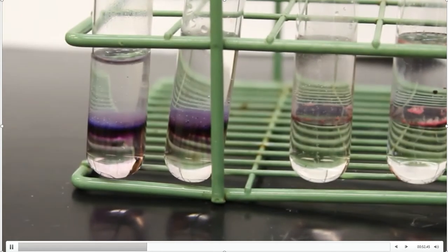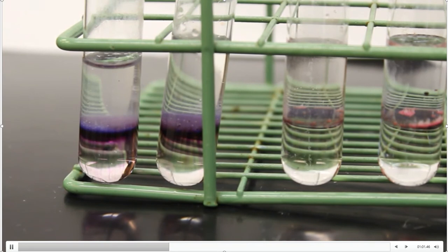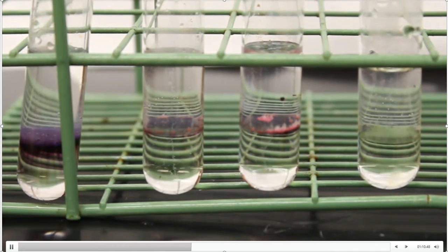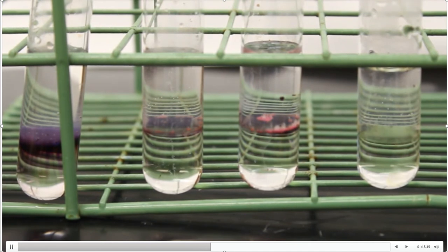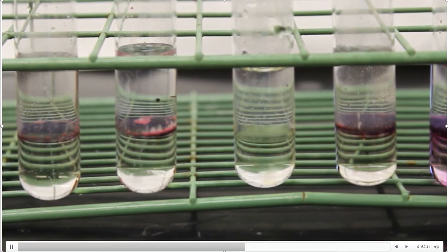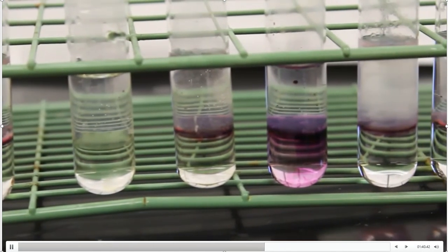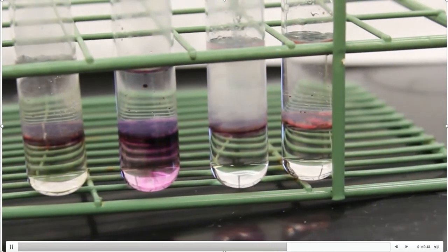I'm going to bring this forward and zoom in a little bit. The first test tube is sucrose. The second test tube is fructose. The third test tube — do you see that interface ring? Is that purpley to you? That's going to be the question you'll have to answer for yourself — that is maltose. The next one is an unknown, and beside of it is another unknown. Then we have lactose, then xylose, then starch next to last, and at the very end, glucose.